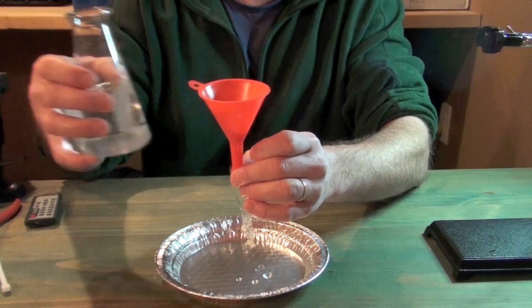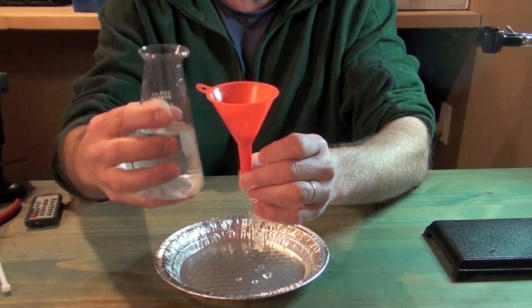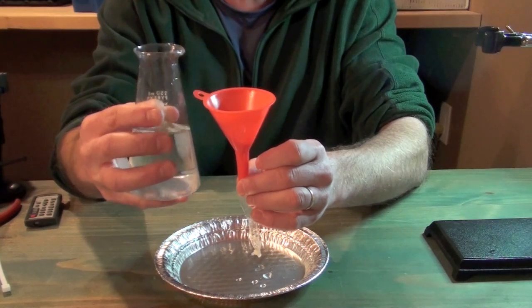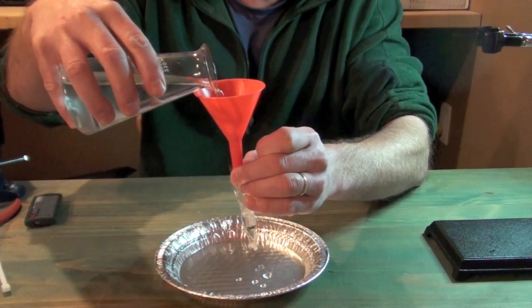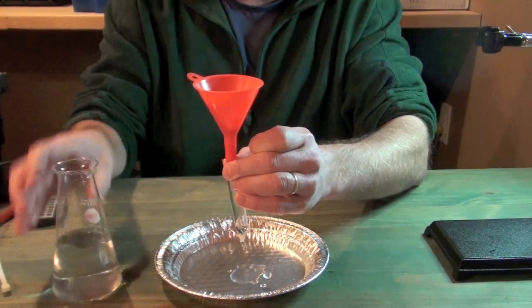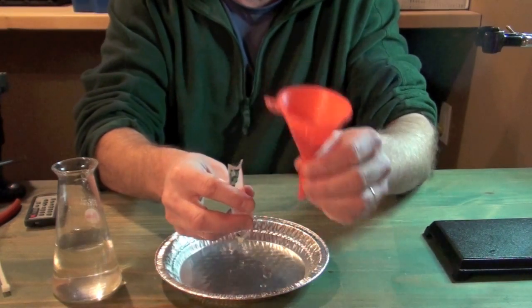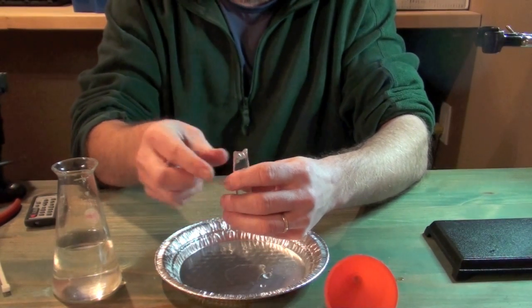And then we're going to take our test solution. In this case, I've got a strong sugar solution. This is going to be our hypertonic solution that fills this particular baggie, and we're just going to load up this baggie right up to the top and let it overflow a bit. Now we can remove our funnel and just hold our baggie open at the top.